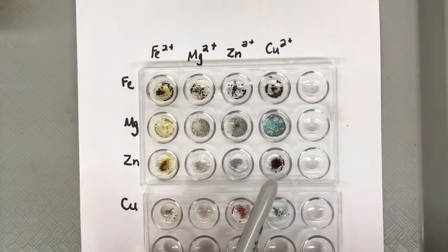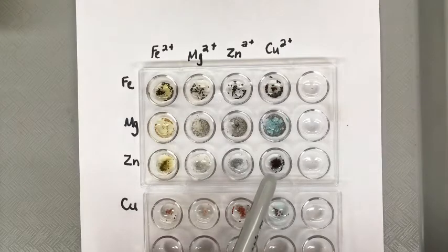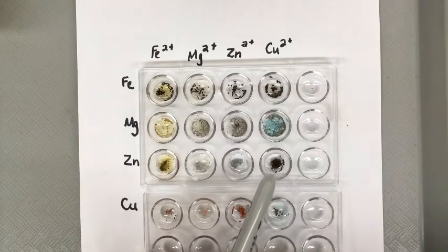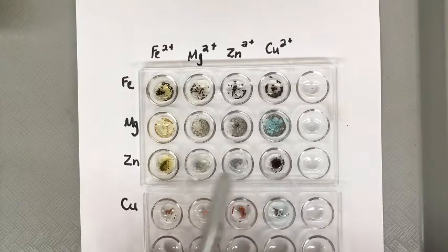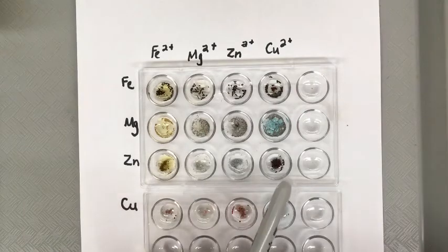But then when you move over to the copper solution again, the particles have changed from a silvery color to an orangey red color. So there's been a reaction. So this one would be check, X, X, check.